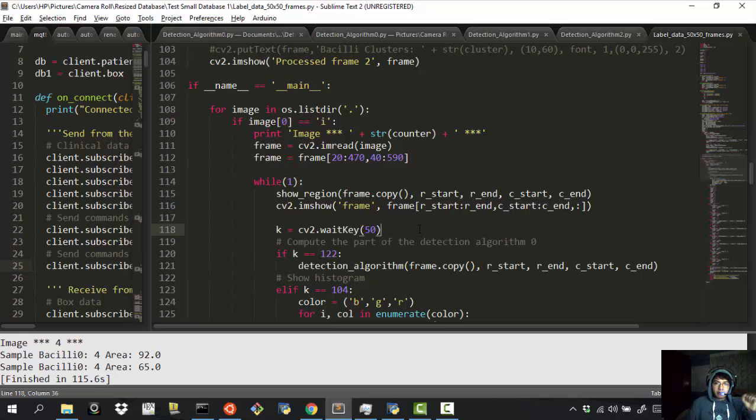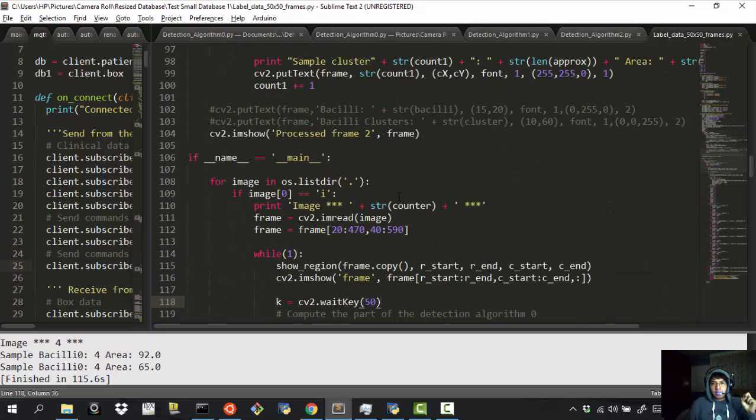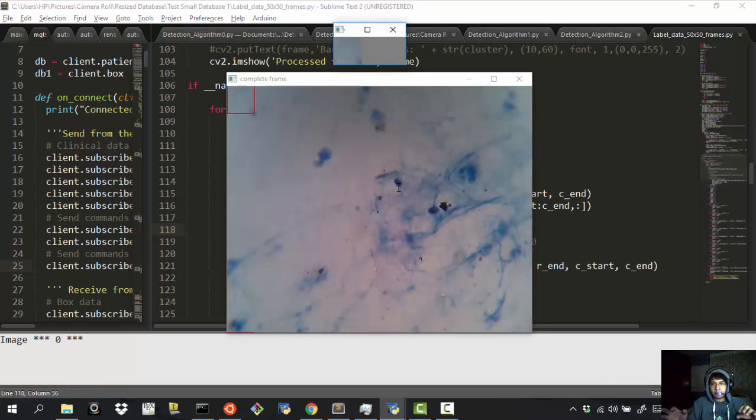Okay, so in this video I want to show you how I am classifying the images in the first instance. I have just created this small program in Python using OpenCV, and what it does is iterate through the whole database that we created a few months ago. As you can see, you get this screen, in which you have the whole image and here the ROI, the region of interest of the image.